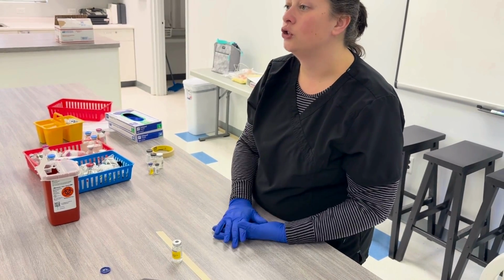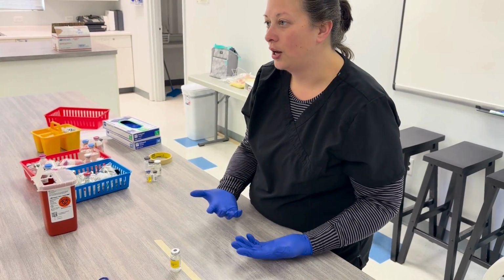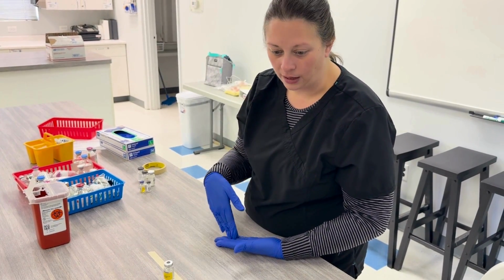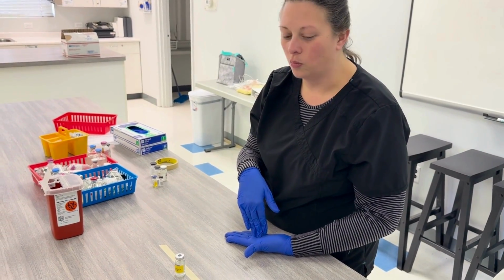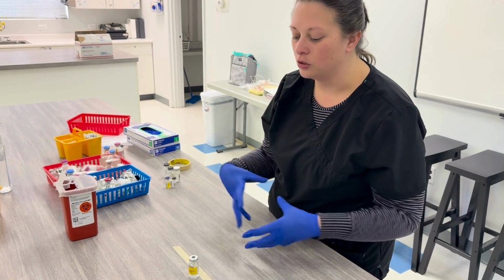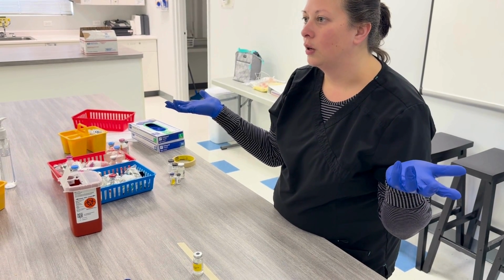And now it has to dry. If you do not allow the alcohol to dry, then it hasn't done its job, and you can also introduce alcohol into the compound. So the only way alcohol works is if it's dry. That's the whole purpose. It saturates the germs, pathogens, whatever is on there, and then, poof, it's gone as it evaporates.